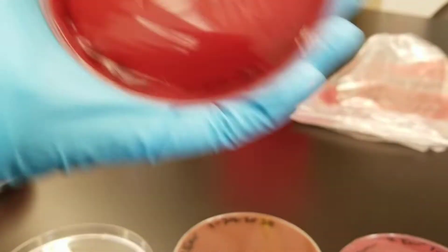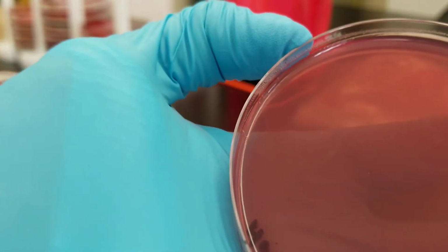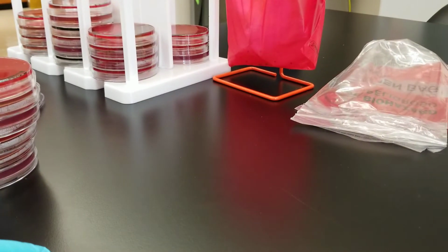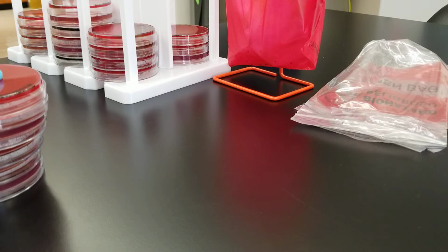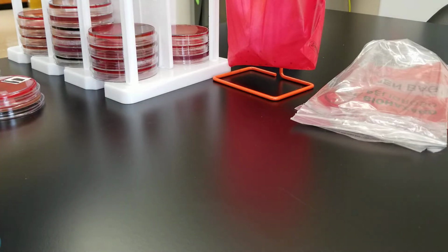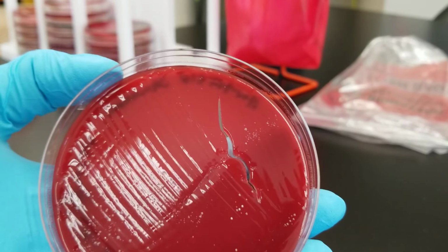Really? Nothing. Okay? Again, nothing. We really didn't get anything on any of these. The people that they were collected from had just cleaned their ears the night before with hydrogen peroxide, so we weren't really expecting to get anything there. If anything, we would have probably gotten maybe like skin normal flora. We didn't really do middle ear. They were asked not to go all the way in their ear, just the opening. You know, you're not supposed to shove things down your ear.